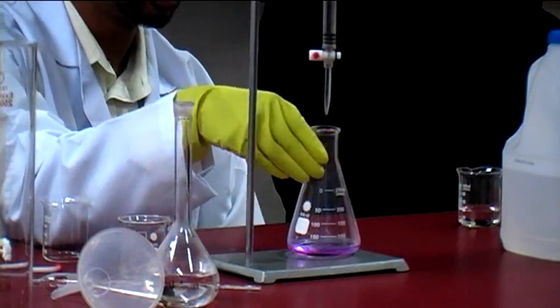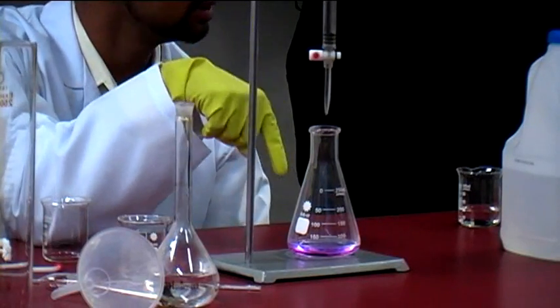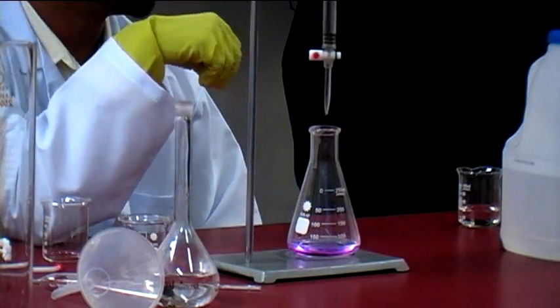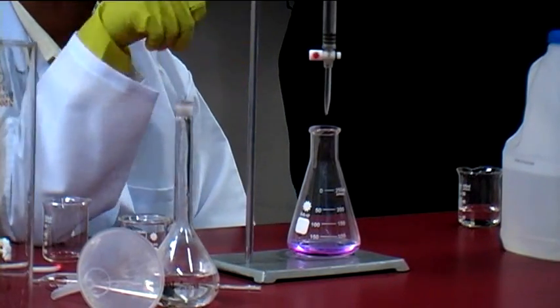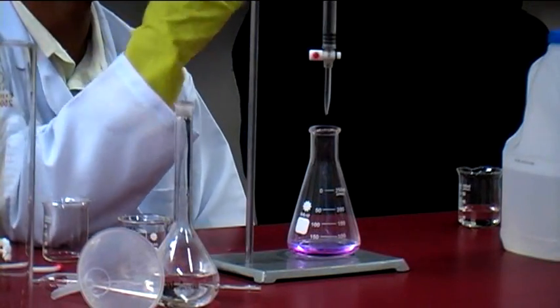What you'll always note is, if you're really observing, you'll note that the exact point where the acid starts to hit the solution, around there will become colorless while the rest remains pink. And then when you swirl it around, that's when you'll see the complete color change.